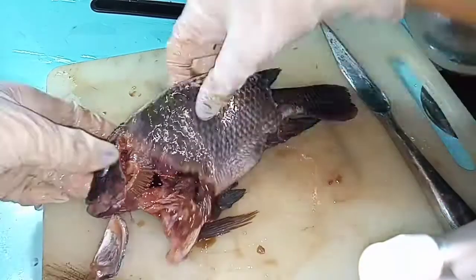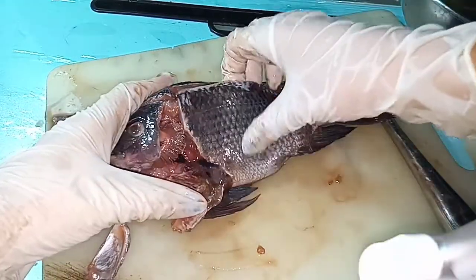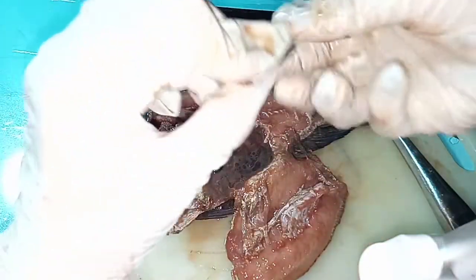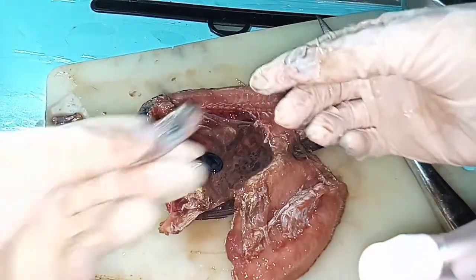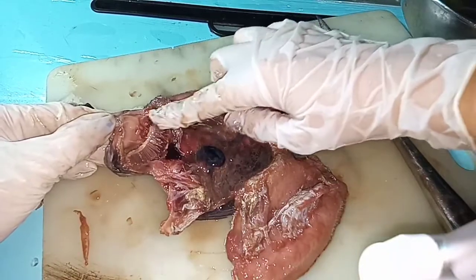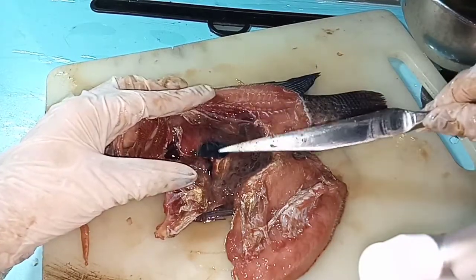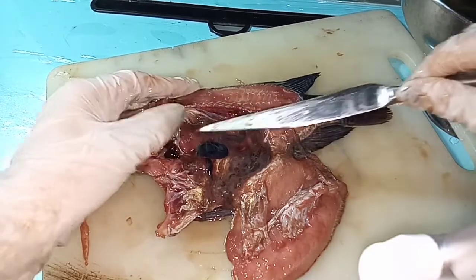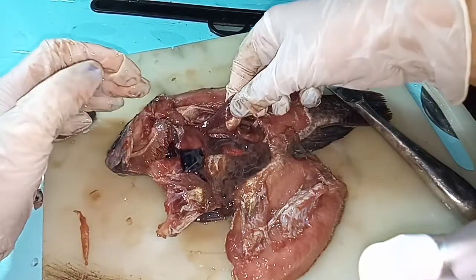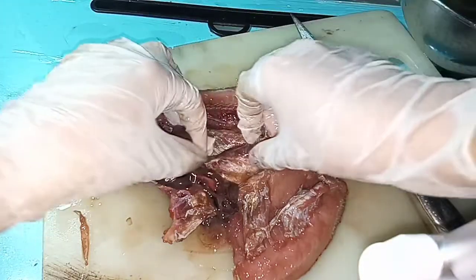Let me repeat it. On this part, we could see the external figure of the fish, and if we open it up, we could see the internal organs. This part of the gills — this is actually the operculum, the protective cover of the fish. Next is the gills. This is the heart. The bigger block — this one — is the liver. Next one is the pyloric caeca. This is the gonad. And on this part, we could see the kidney. This is actually the intestine of the fish. This is the vent.